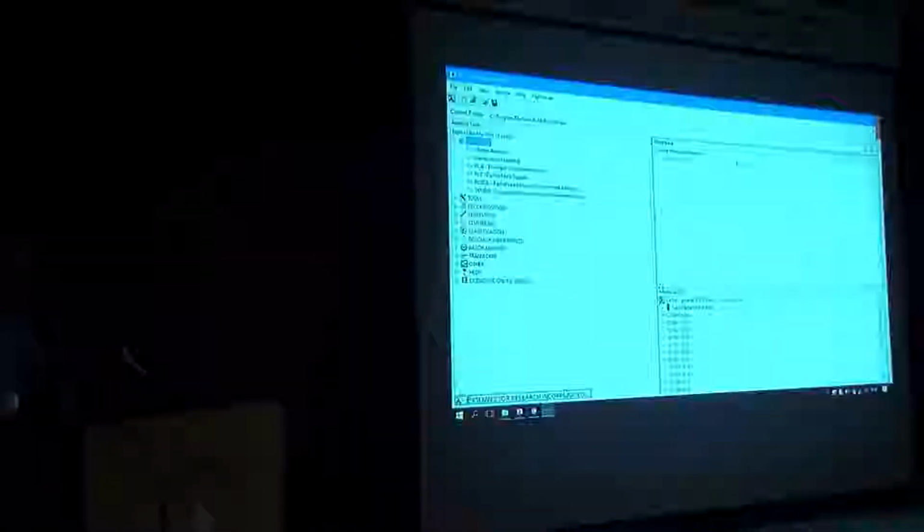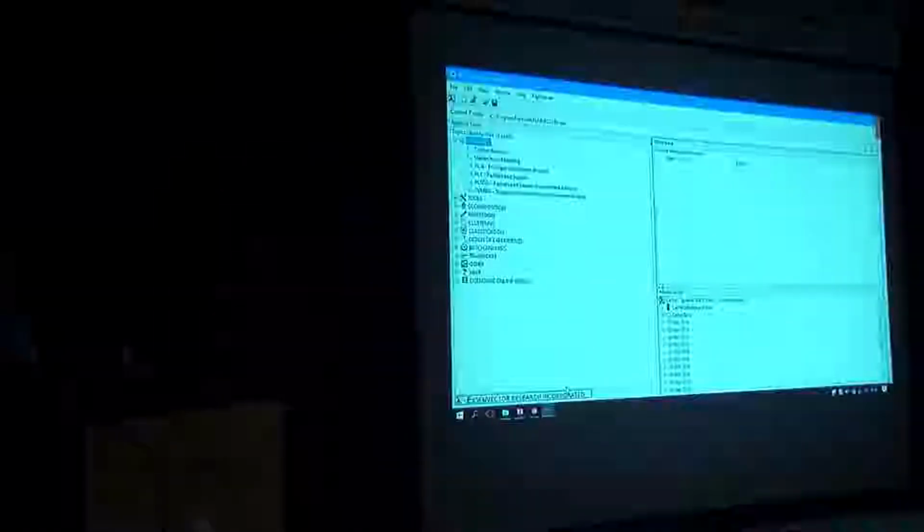So the data set is available from this link, and the software I'm going to use is PLS Toolbox or Solo, which is the standalone version. Have you heard of this software before, or is anybody using it? It's a very good software. I think it's the best standalone software that I know of. Of course, it can be integrated in MATLAB, so you can program it. And that's what we did, because you need to do a lot of automation. So you need that programmability as well.